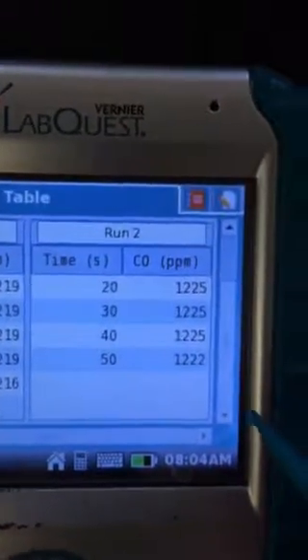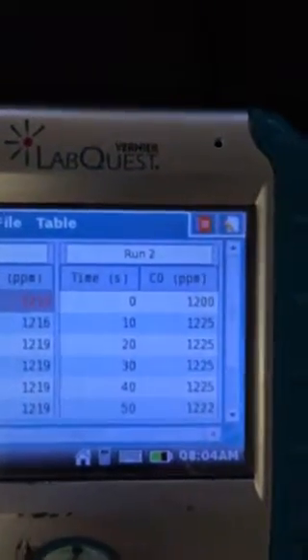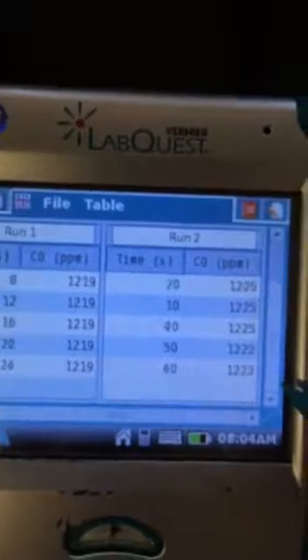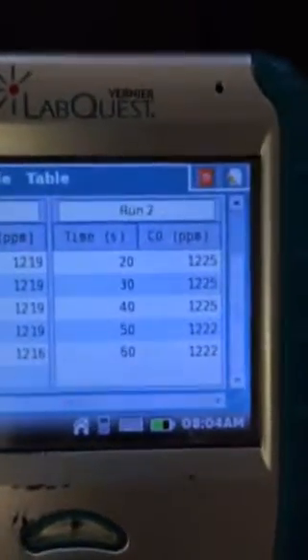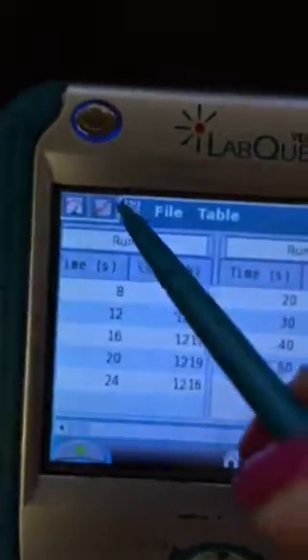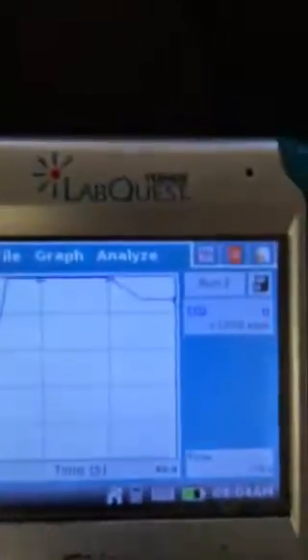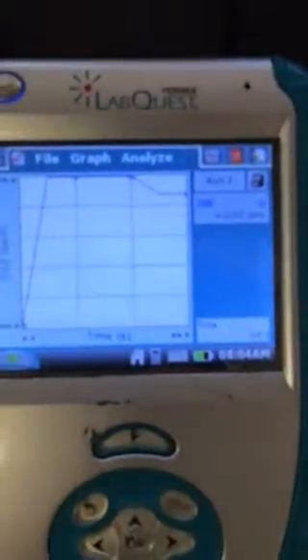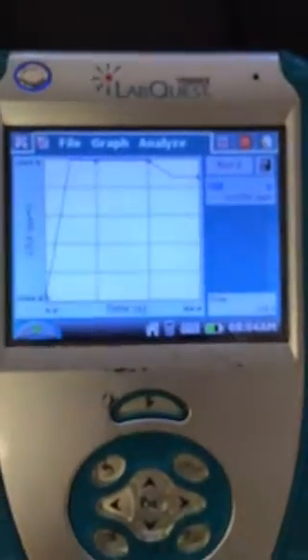But a really strong way to measure this would be to just average all of these. Every 10 seconds, it's giving us about 1222 to 1225. So this is a lot more accurate, and I highly encourage it. And that would be your initial value, your initial reading for carbon dioxide. And then when you want to do the final, you just do the same thing again, run it in the exact same way and get an average.